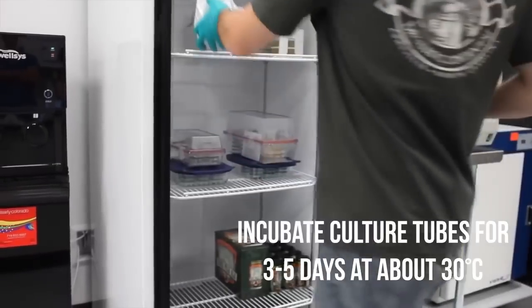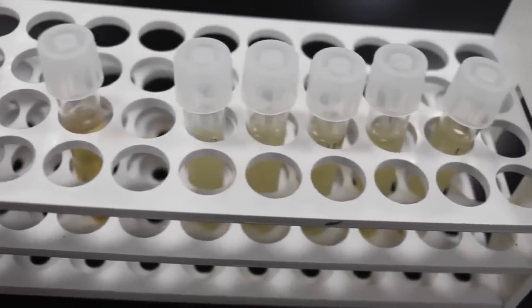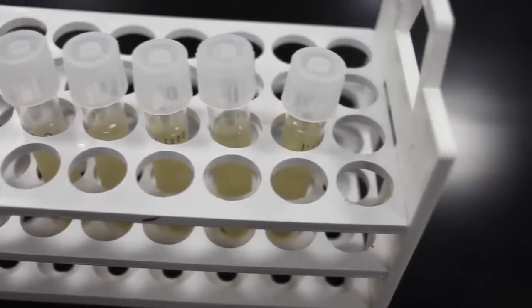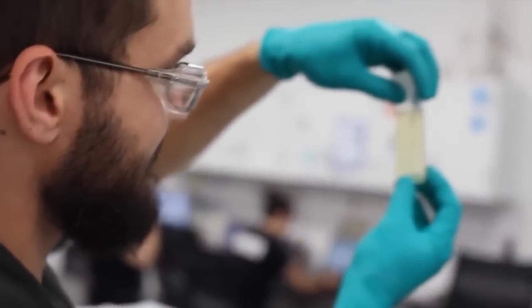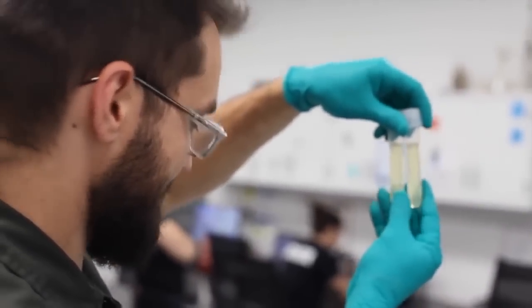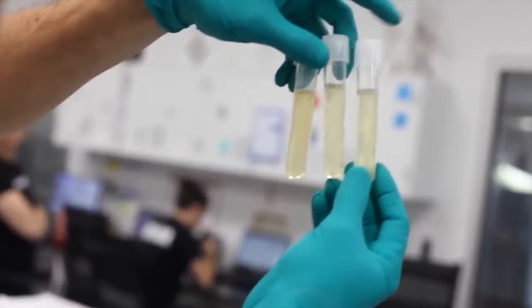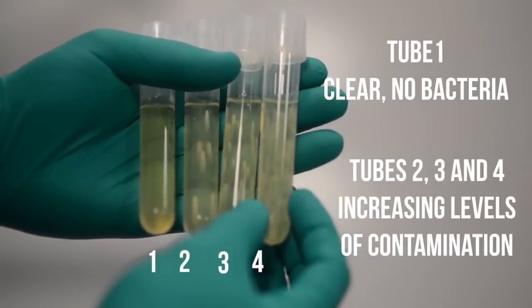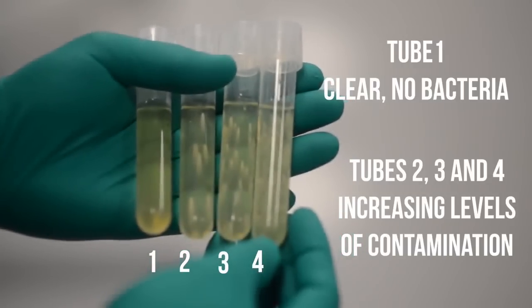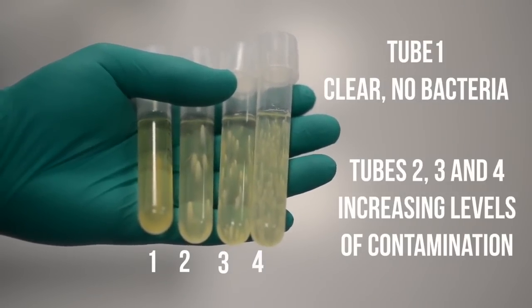Once inoculated, incubate your culture tubes for at least 3 to 5 days. After incubation, you want your media to be nice and clear. Colony growth could indicate a beer spoiler contamination. You may find a little haze in yeasty beer samples, such as those taken from early fermentation. Lactobacillus will typically form little swirly colonies in the media, while Pediococcus will typically form little balls. But it is important to note that this is not always the case. In badly contaminated samples, often you cannot distinguish individual colonies and will see only opaque growth. Every now and again, you may even find a colony of cyclohexamide-resistant wild yeast.